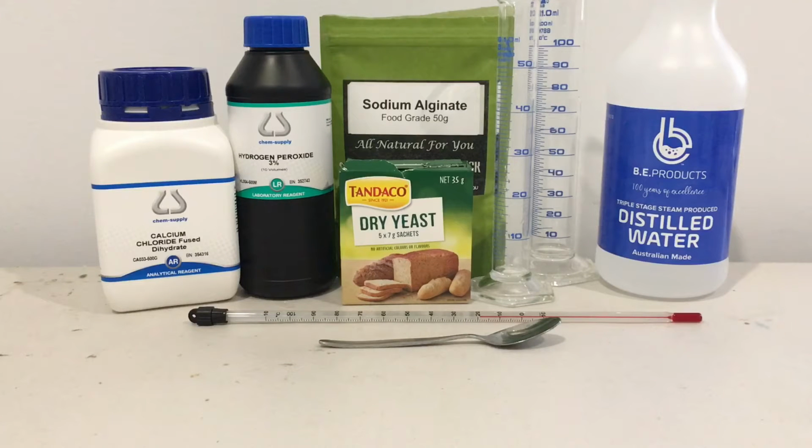Hi, Year 12 Biology. I am just getting ready to set up a little experiment for you here. The name of this one is called A Twist in Measuring Catalase. Now, what we are doing today, we're going to be using all the equipment, chemicals and ingredients that you see in front of you in this video.